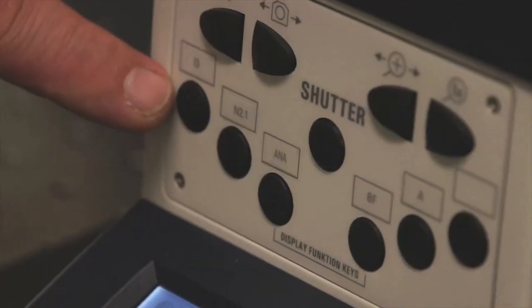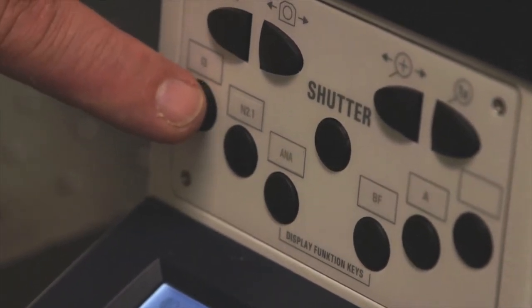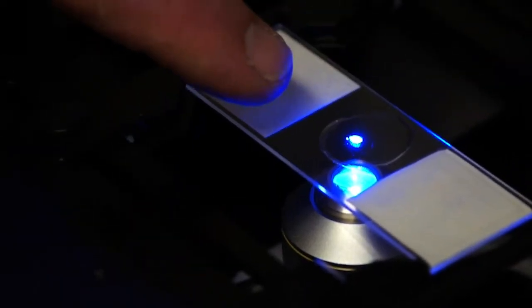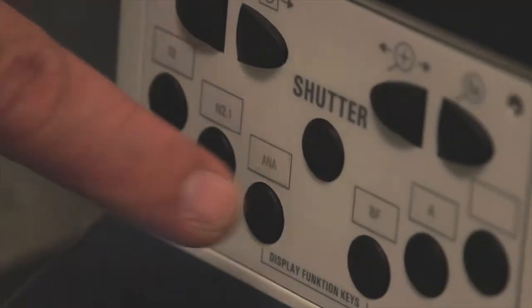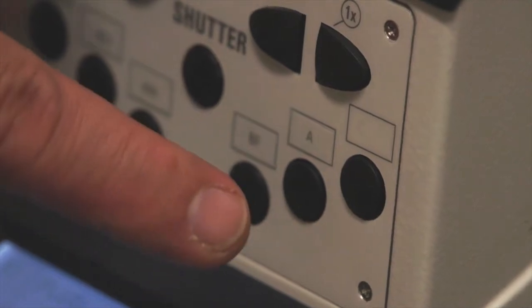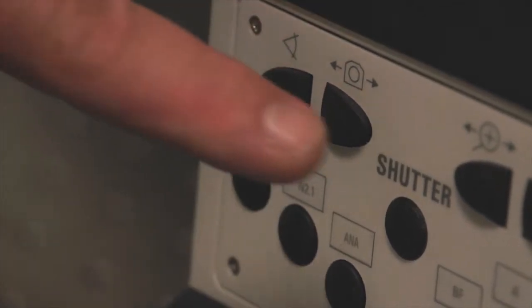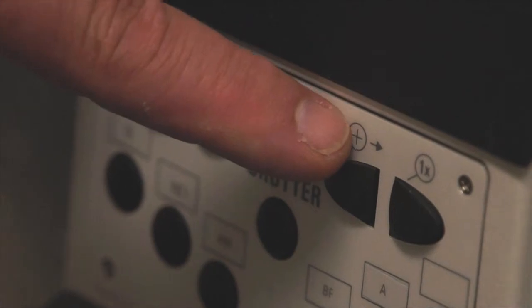To actuate the filter packs inside the microscope, you press the buttons on the front of the microscope which allow you to select one of the 4 filter packages. This button is for FITC, this button is for rhodamine, this button is for DAPI, and this button is for green fluorescent protein. Do not touch these 2 buttons on the front of the microscope, and only rarely will you actuate one of these buttons, which we will discuss at a later date.